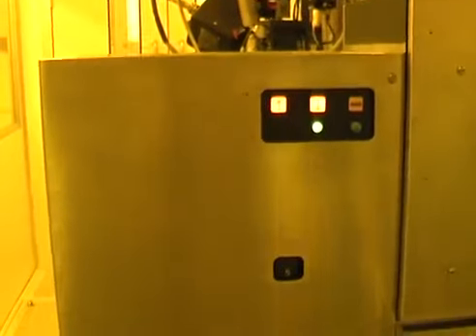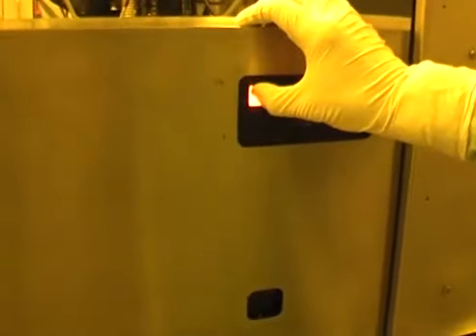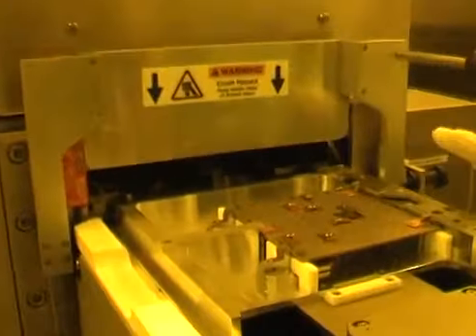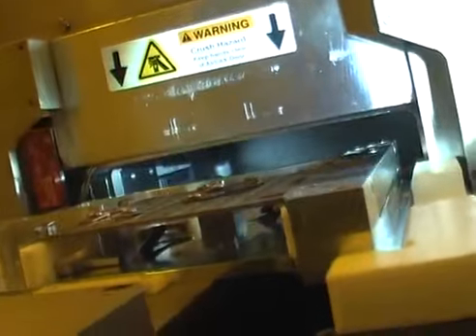At the moment, we'll notice that the load lock's in position 5, so I'm going to change that to position 8. Now I can open the door. I can open here. If you look inside, maybe if I add some illumination, it helps you to see better. Okay. You can see the slots where it's going to go.